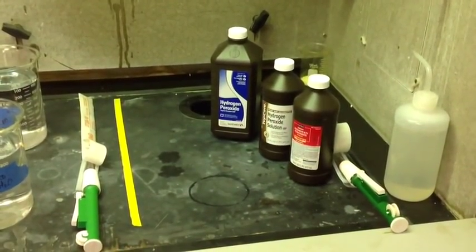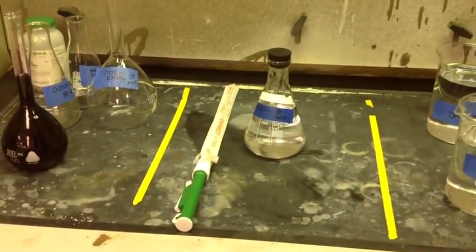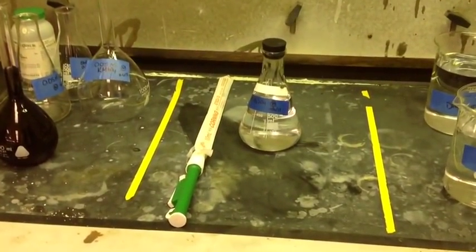In the hood each of the three sections are kept separate, those lines dividing them. Please do not cross contaminate. The graduated pipettes especially need to stay within their own sections.